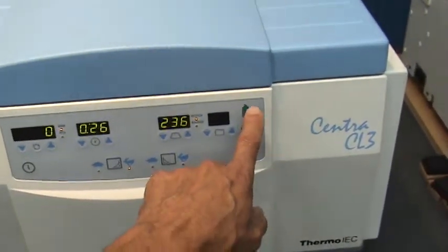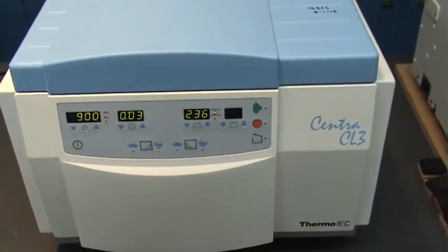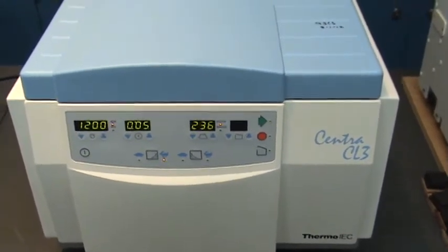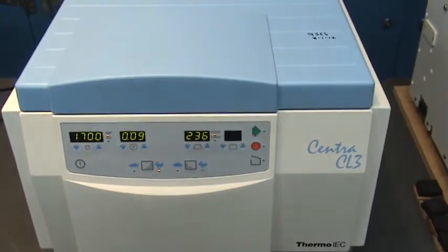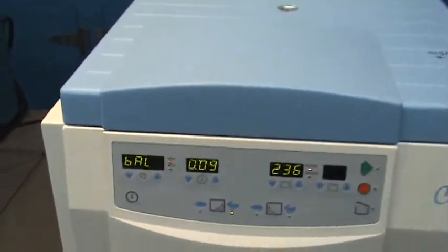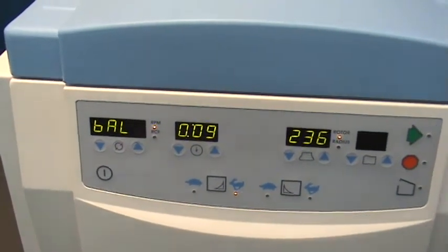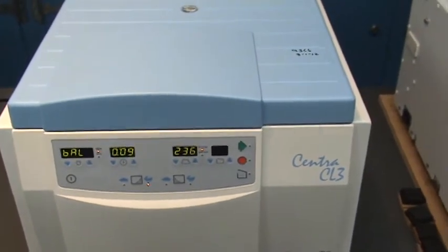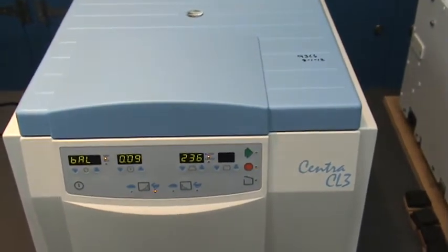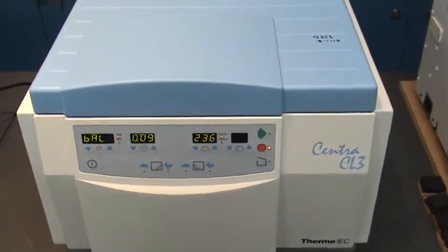If we try to run this centrifuge now with that imbalance set at 2600 RPM, you'll see that it attempts to bring it up to speed and quickly goes out of balance and shuts itself off. It's simply too much mass for this particular automatic balancing mechanism to tolerate.